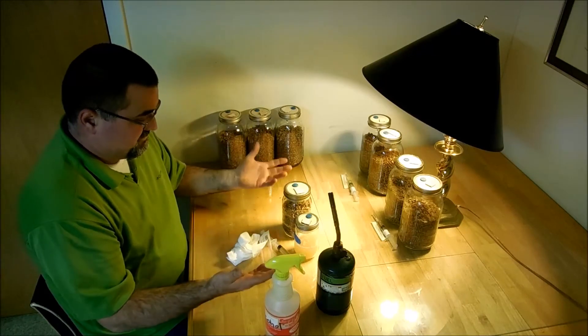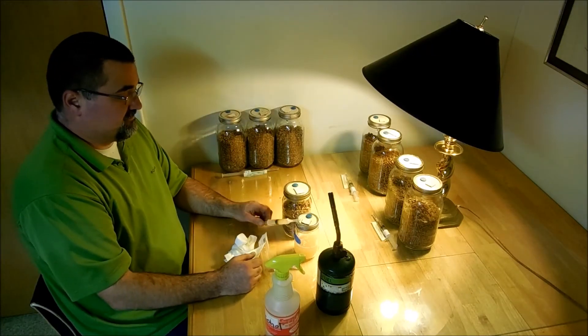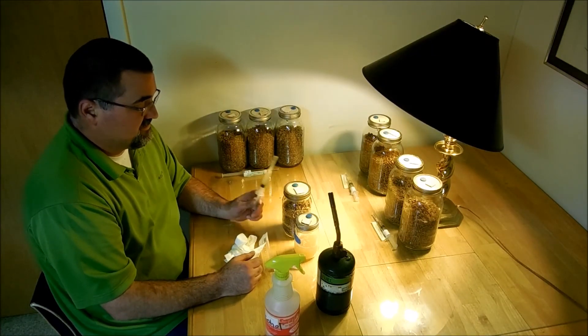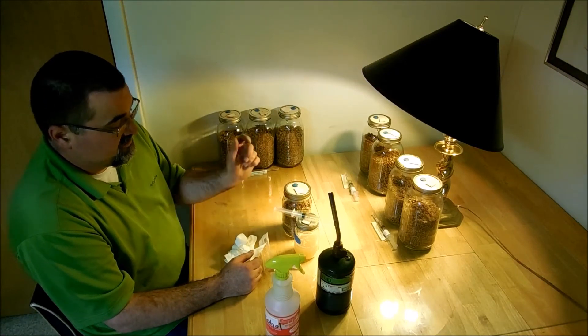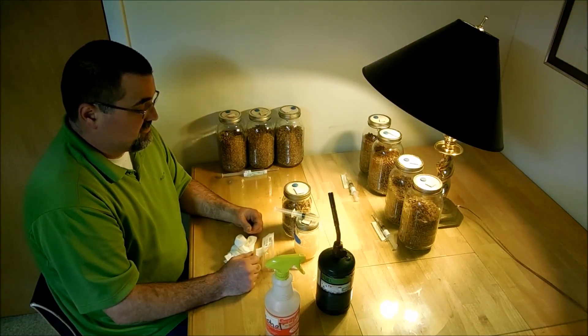So that is how I draw from there and test it. And then I'll hang on to this and wait and see what the results are.